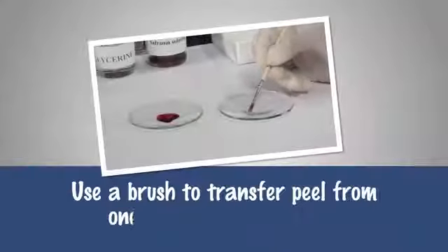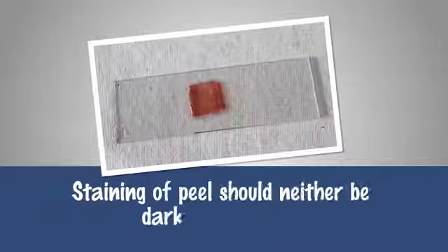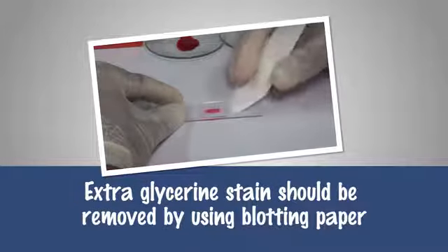Precaution: use a brush to transfer peel from one apparatus to another. Staining of the peel should neither be too dark nor too light. Extra glycerine stain should be removed by using blotting paper.